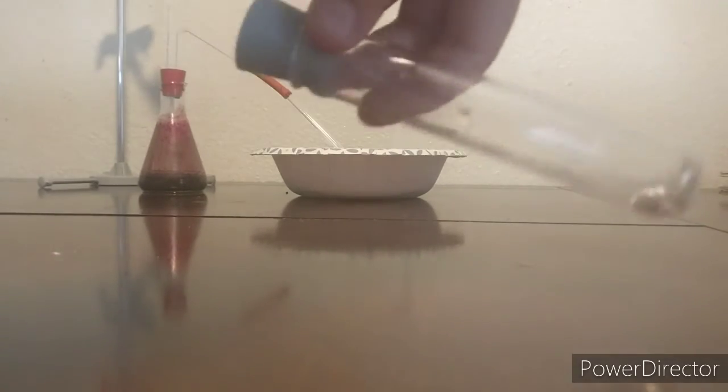I don't think I did a good enough job of getting rid of the water, so a lot of it's still there, and that's going to be important for the later test.